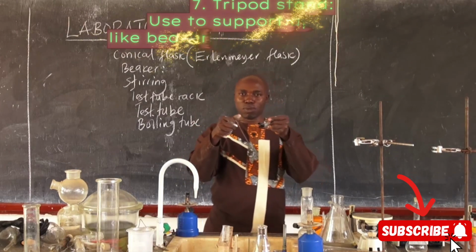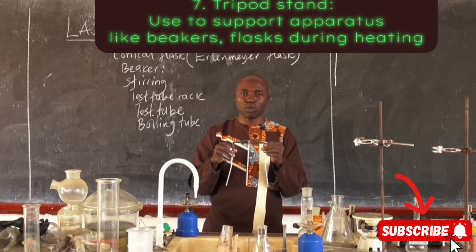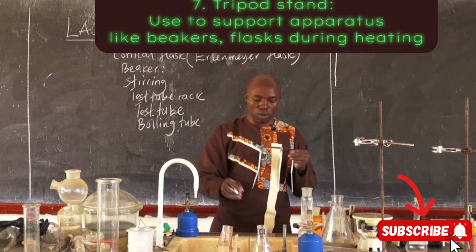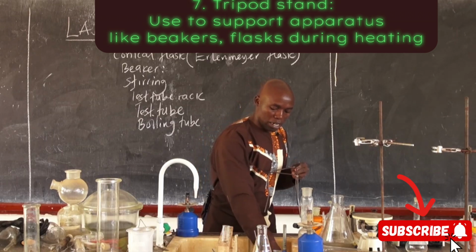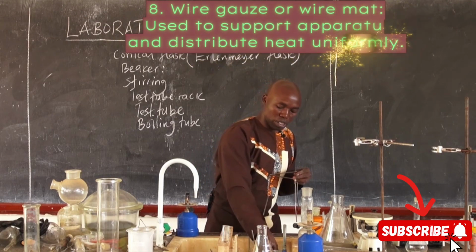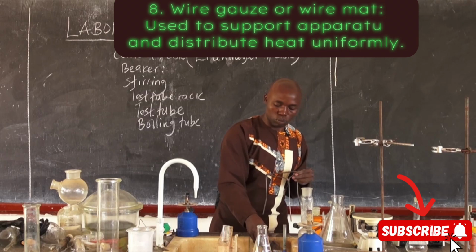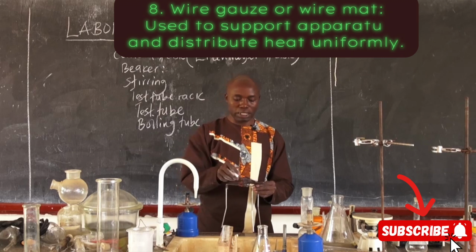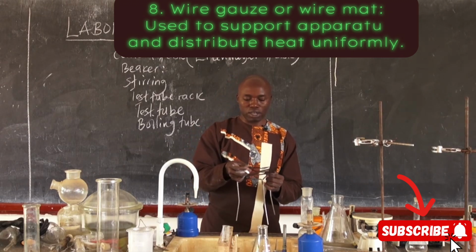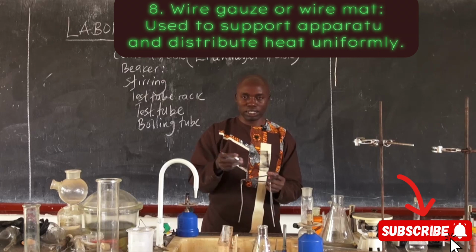This is called a tripod stand. It is normally used to support. We put on what we call a wire mat or wire gauze, and we normally use it during heating experiments. So we have our wire mat, or we call it a wire gauze. Wire mat or wire gauze, it's here.